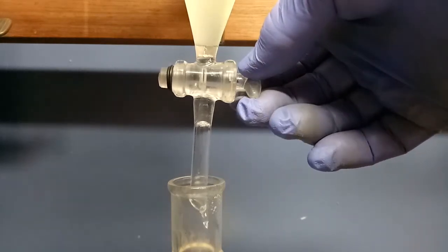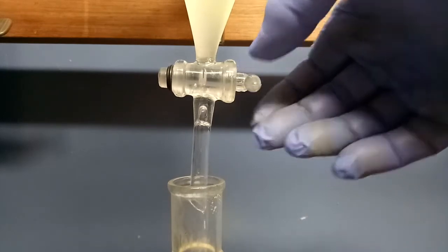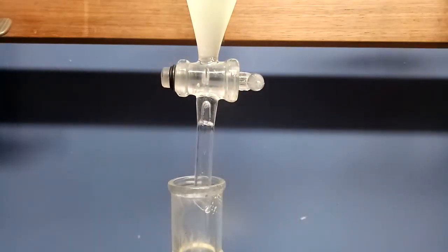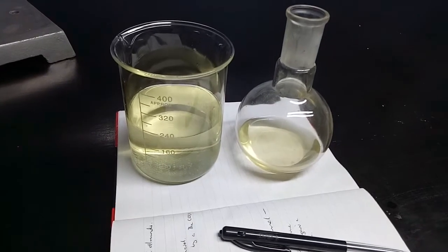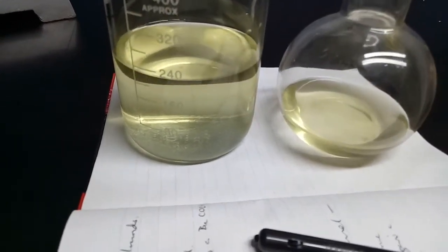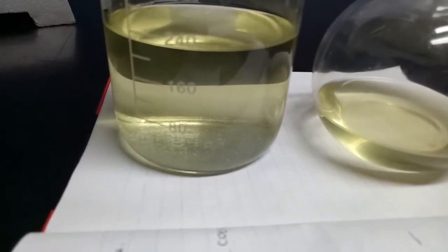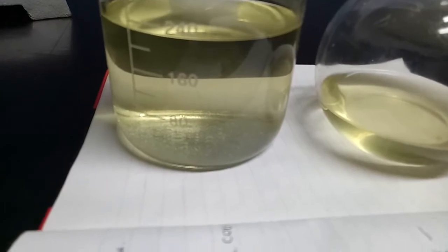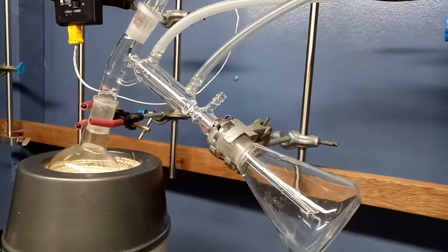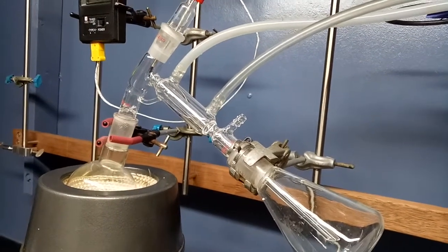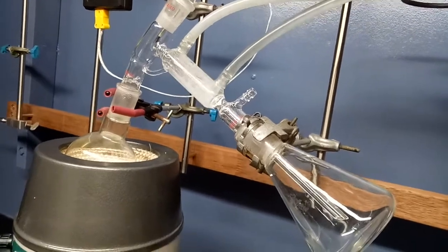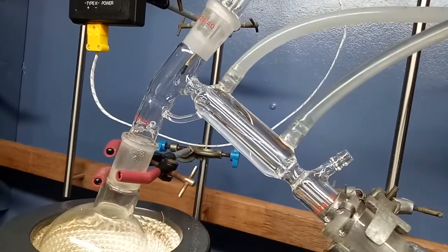Four extractions were done. Well, two actually. I had to split it in two parts because I only had a 250 ml sep funnel. And, what we end up with is an aqueous phase and an organic phase, both similar color. And, it's possible that the aqueous phase contains some benzoic acid, and the other phase might have our benzaldehyde, if there is any.